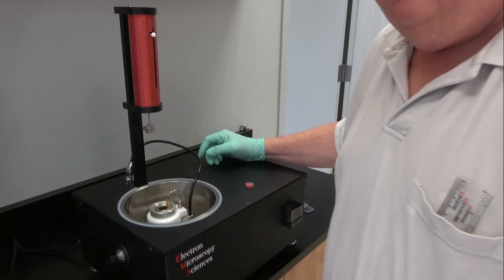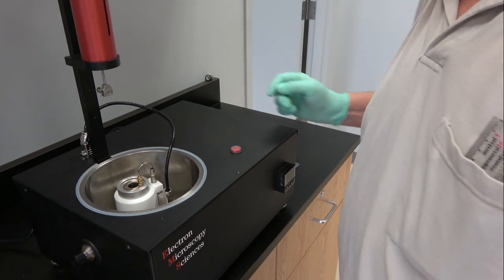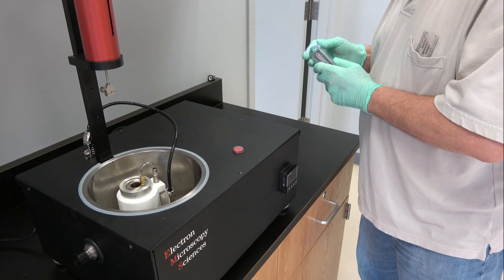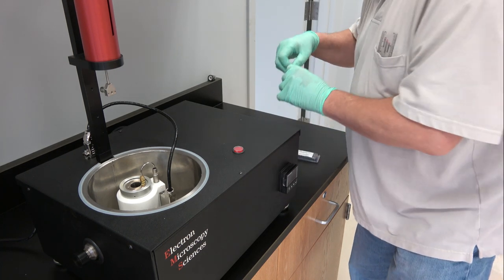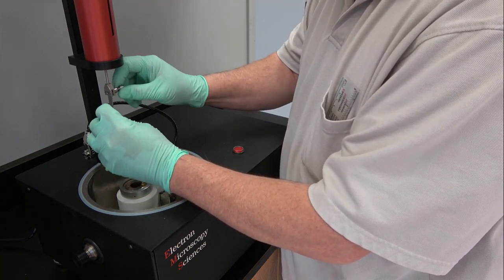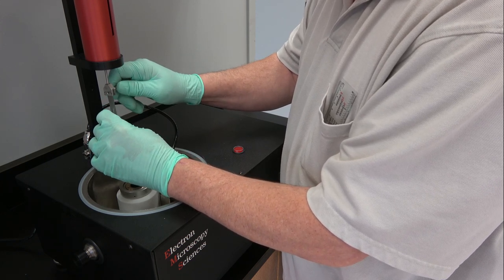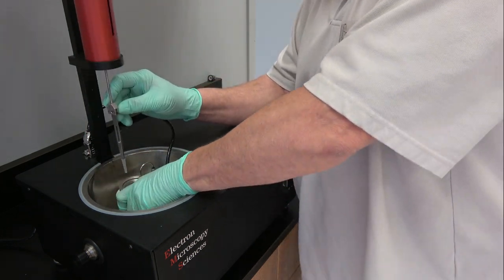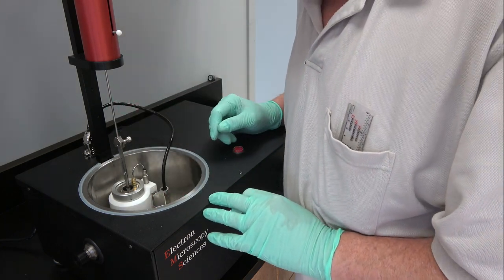The next step is to line things up, and for that I will install a pair of forceps into the holding mechanism. And I'll gently lower this and move things so they're perfectly lined up.